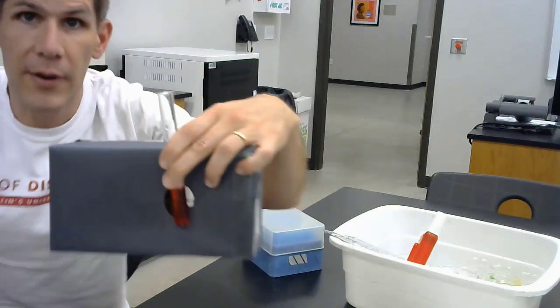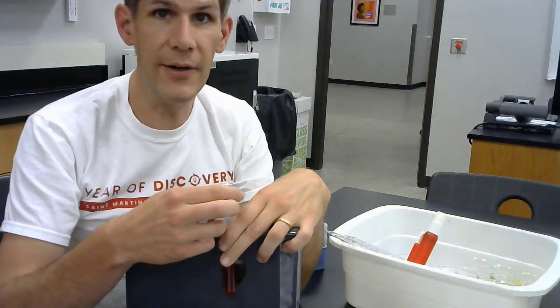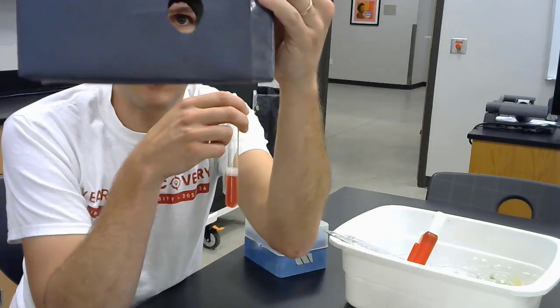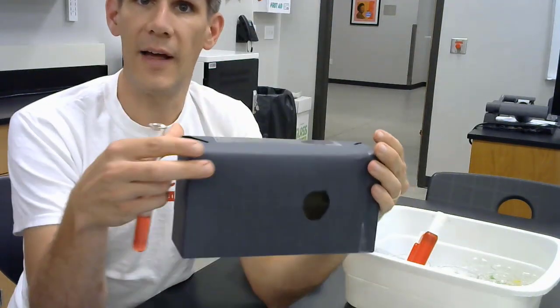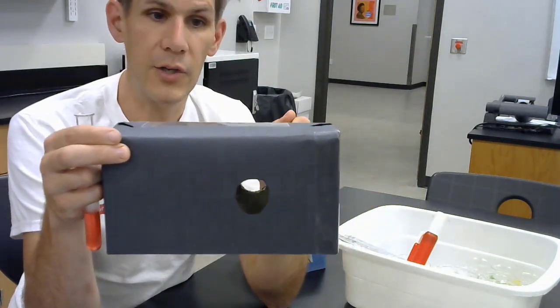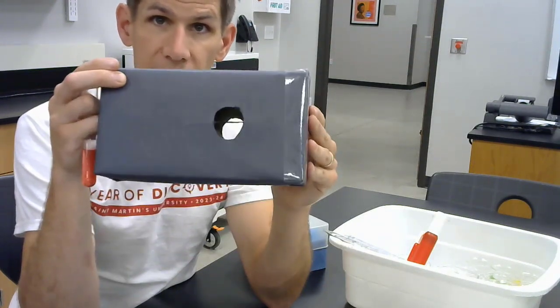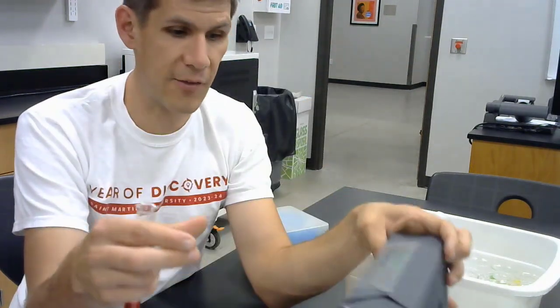So this is how we are going to use a pipetter, a test tube, some red blood cells, and this black box to measure the lysis of cells. You're going to put your flashlight through this, if you have a flashlight on your cell phone, and that will help you to see things. We are going to time how long it takes for the cells to lyse, and know that the longer they take to lyse, the slower the molecule is moving into them.